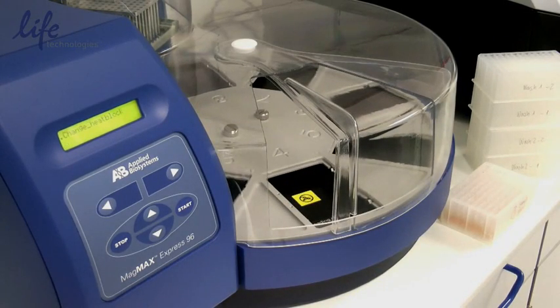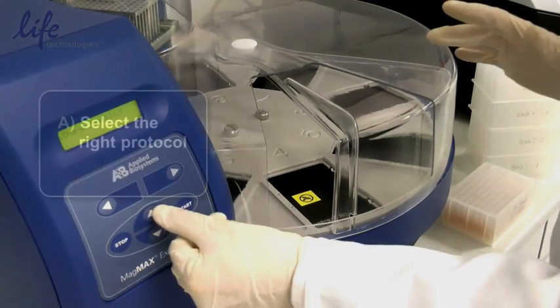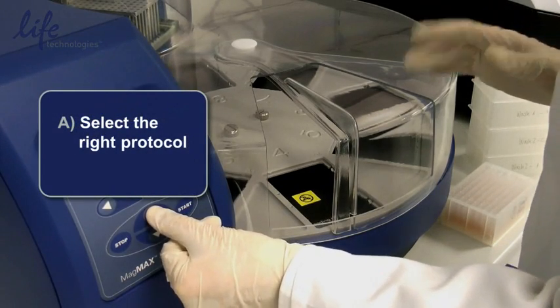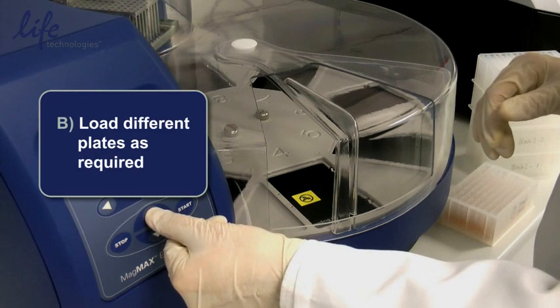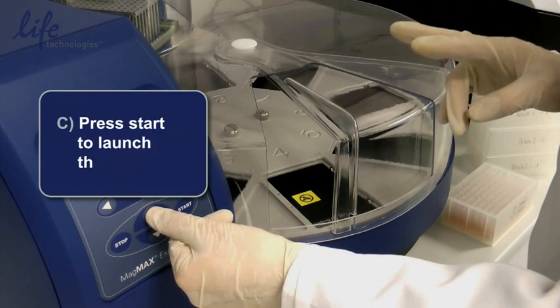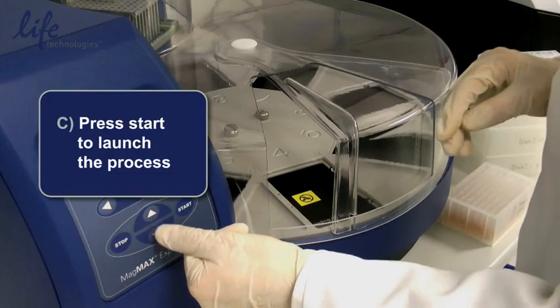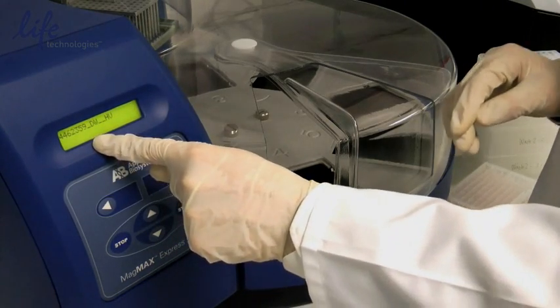The only thing we need to do with this MagMax instrument is select the right protocol for the chemistry that we're using. In this case there are only two options, high volume and low volume. We're simulating the extraction of blood on high volume, so this is the script that we need to use.